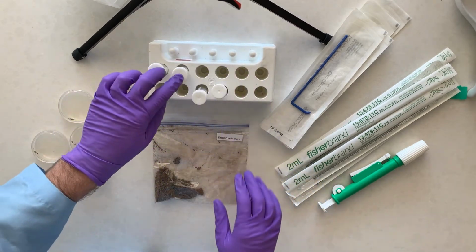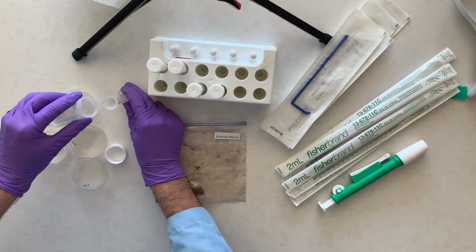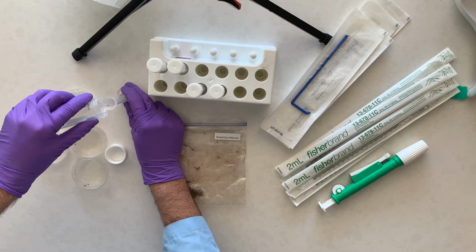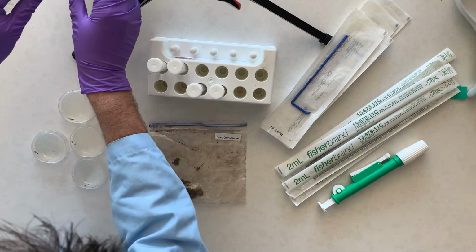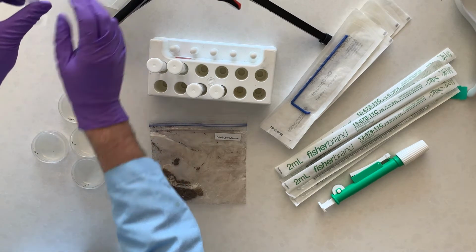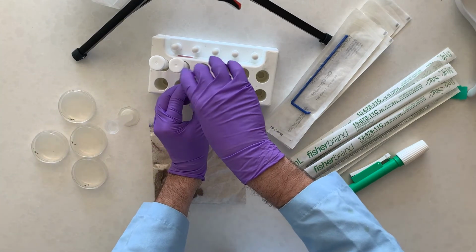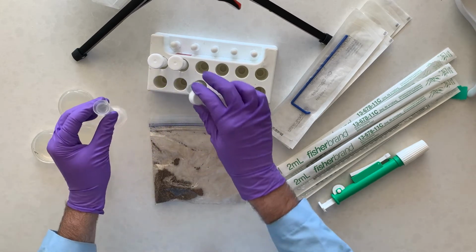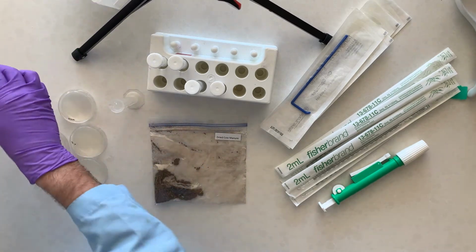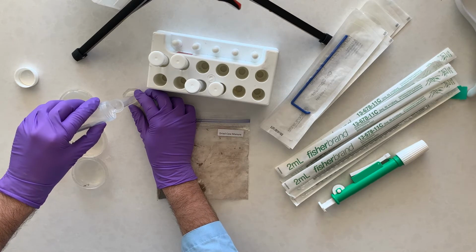And you can see kind of what my method is. Once I've done them, I move them back in my rack. I have 2 more that I need to do. It's got a little too much in there. Again, we're using the graduated cylinder because it is much more accurate and precise than using the markings on the side of the tube. I know there are markings on the side of the tube, but we're trying to be as careful as we can and to get the most accurate and precise measurements that we can.